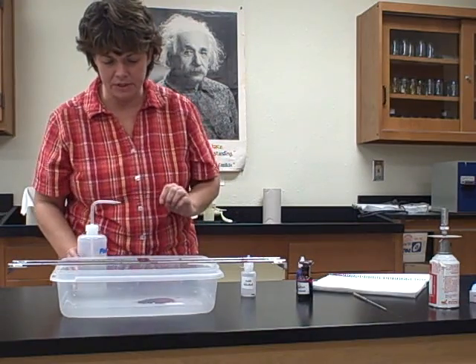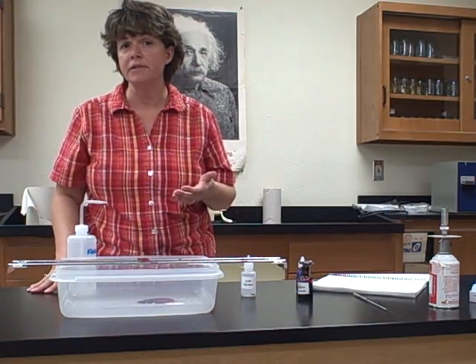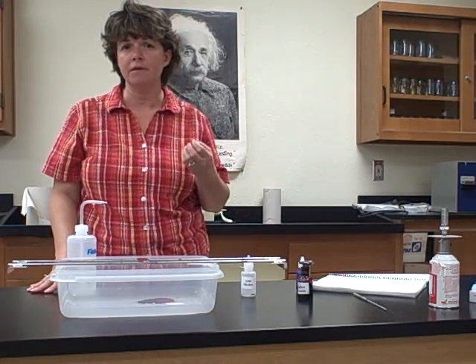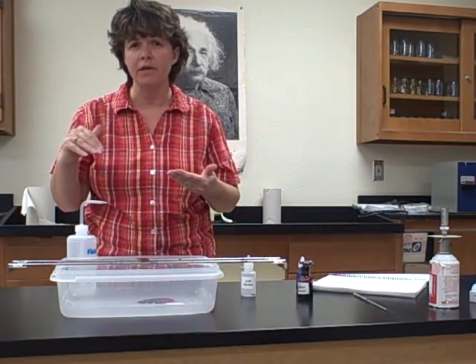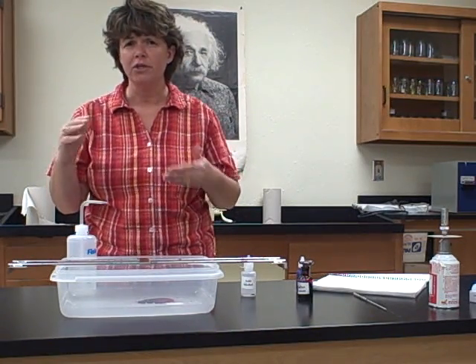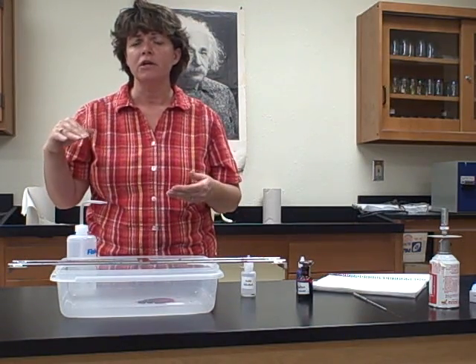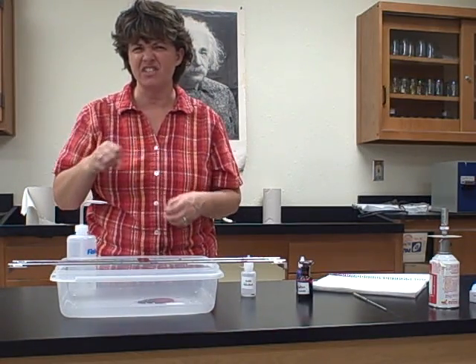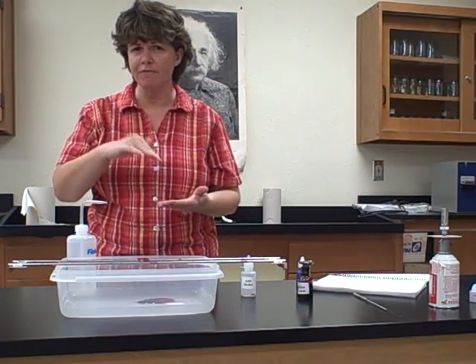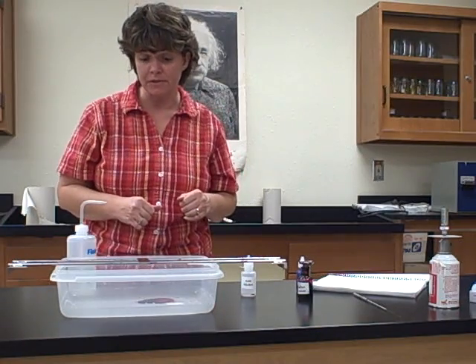Now, one of the things I wanted to talk about with the bacteria is one of the bacteria that we're using, the Mycobacterium genus. They're very, very thick, sticky cells because of the mycolic acid. So when you go to get them off the media the first time, you're going to get a real clump of them. And remember, when you take something from a solid, you add a drop of water first. So when you go to take the Mycobacterium off the solid, you're going to get a loop full of it and kind of spread it around in the water to really break it up, because you'll have it all stuck together. Also remember, when you're taking from a solid, to never gouge the media, because you don't want to be staining media, you want to be staining cells, okay?